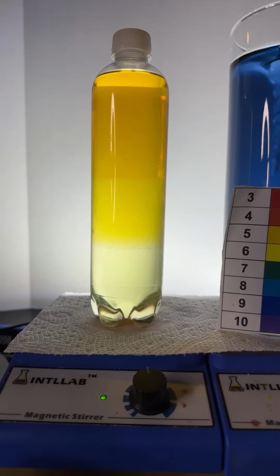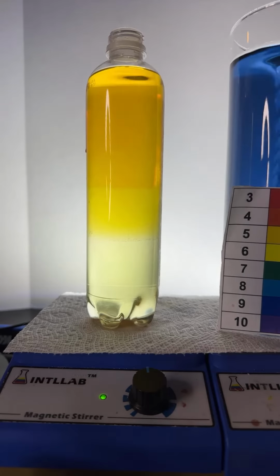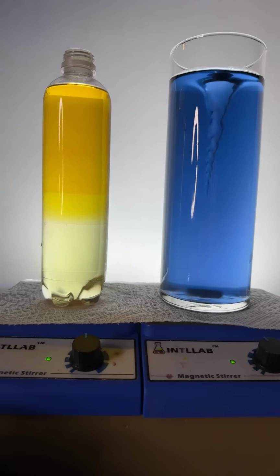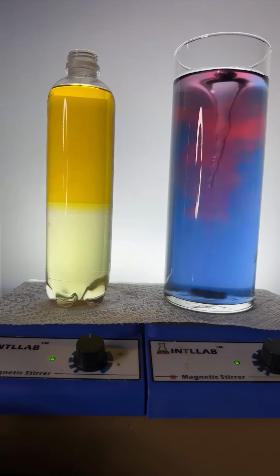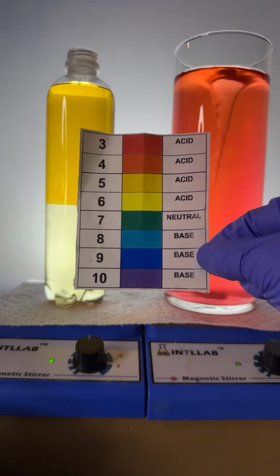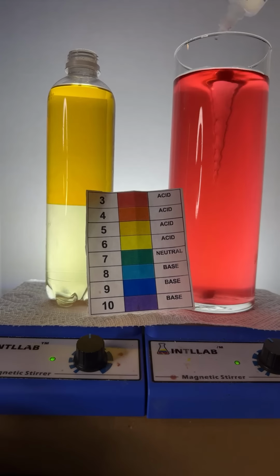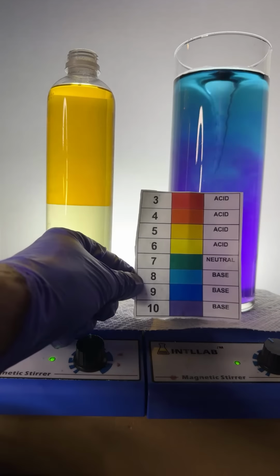So what I'm doing, watch this. I'm going to open the bottle just so you know. In this bottle is the same dye that's in this one over here. They both contain the same dye. Now watch what happens when I start to add acid to this flask on the right. You notice that things start to get more red. That's because the dye behaves like this. More acid, it's going to go more yellow, orange, or red. Now watch what happens when I start adding base. Boom, boom, boom. Things start to go more blue.